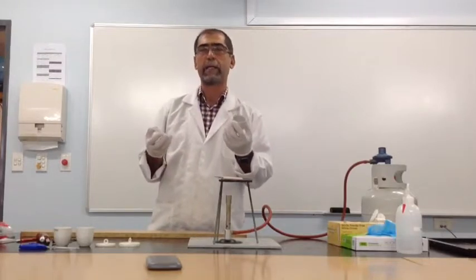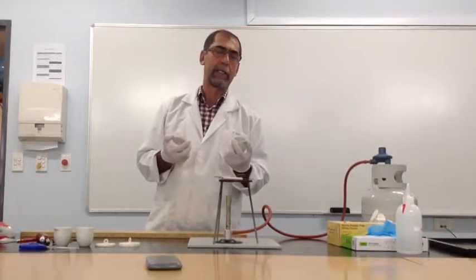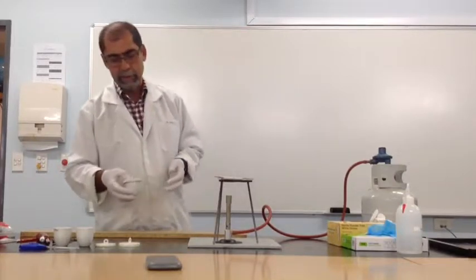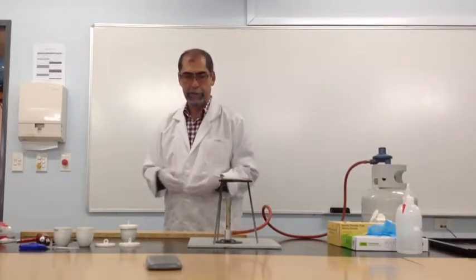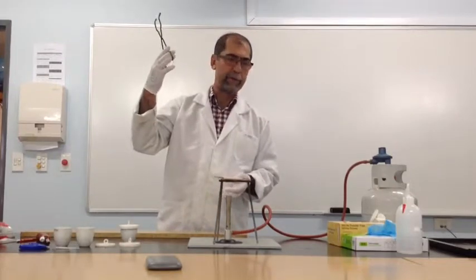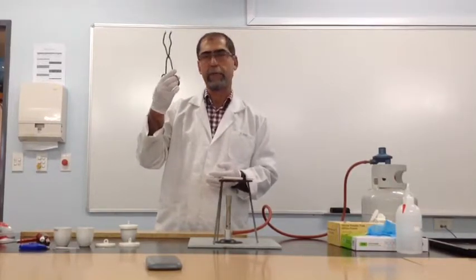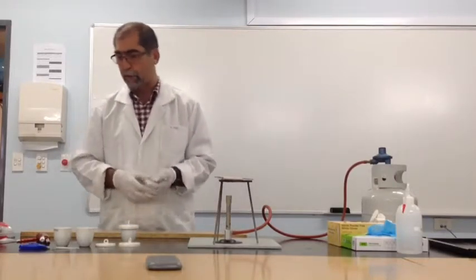It could have some organic matter in there. When we put this crucible on the heat, it will burn the organic matter and cause a negative deviation from the real result. In other words, it will make the result erroneous. Second thing that we will need is a pair of crucible tongs. These tongs are not only to handle the crucible, but are also part of your safety. Please make sure you always handle a hot crucible with a pair of tongs.